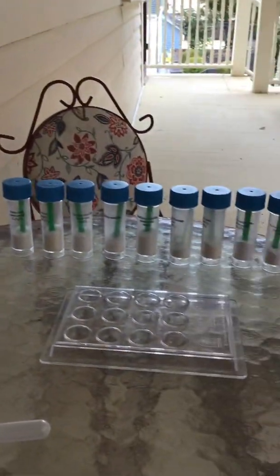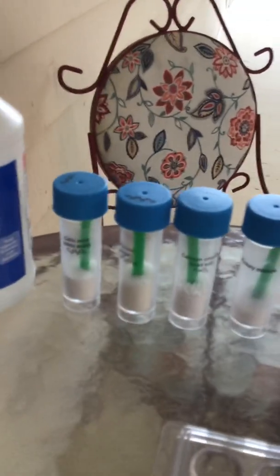Here is your video for slide 15. Here are all of the chemicals.